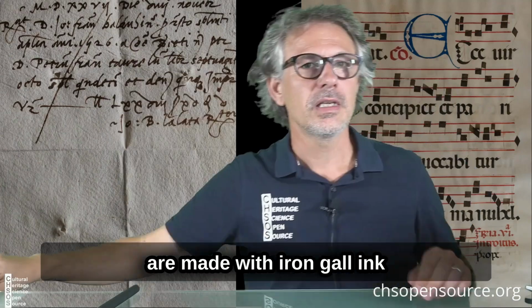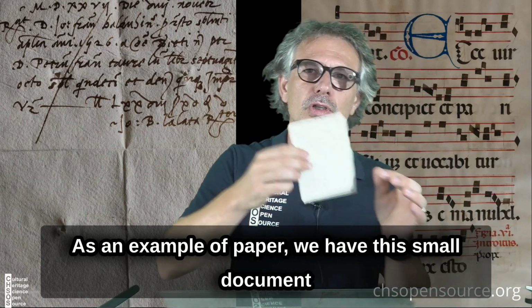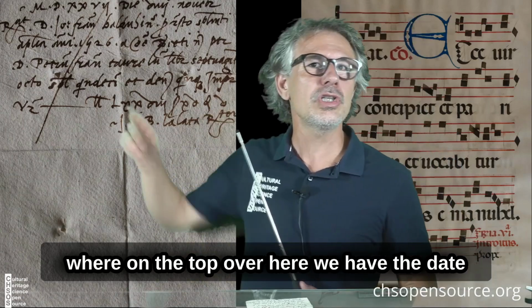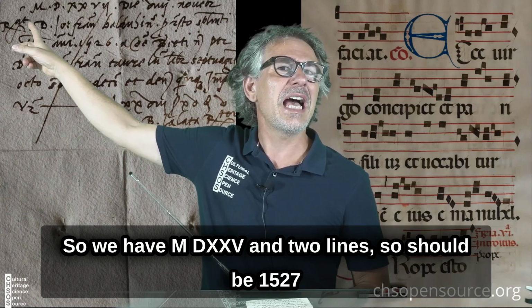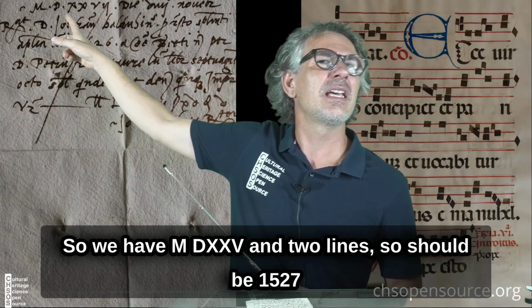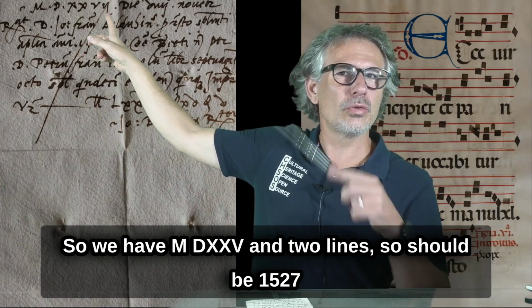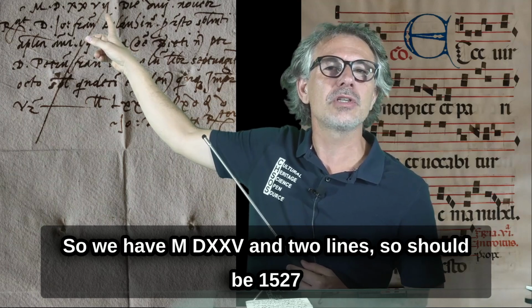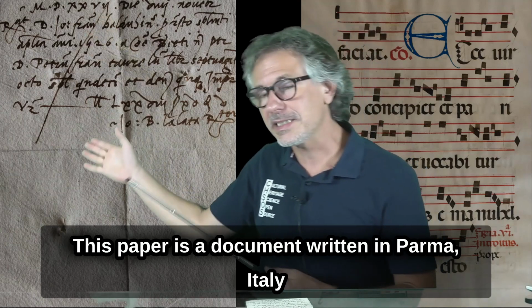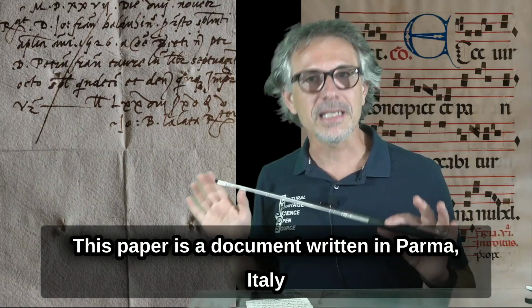Gall ink. As an example of a paper, we have this small document where on the top over here we have the date. So we have M, D, X, X, V and two lines, so it should be 1527. This paper is a document written in Parma, Italy.